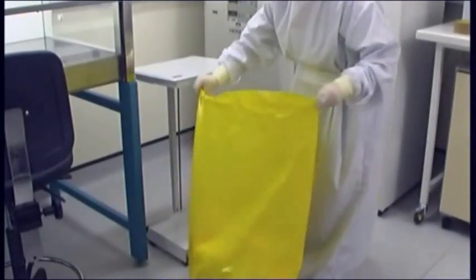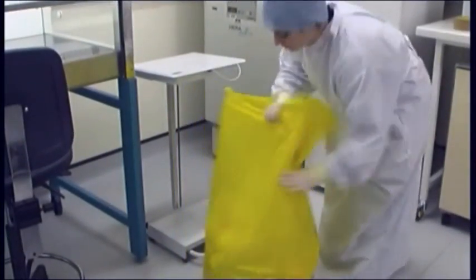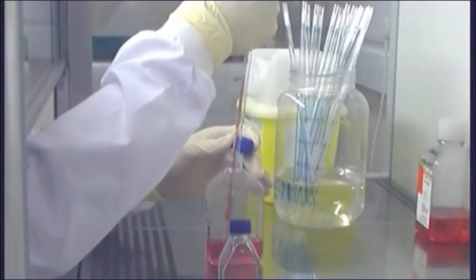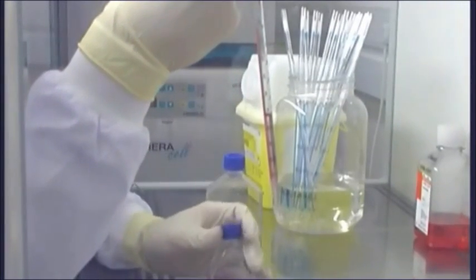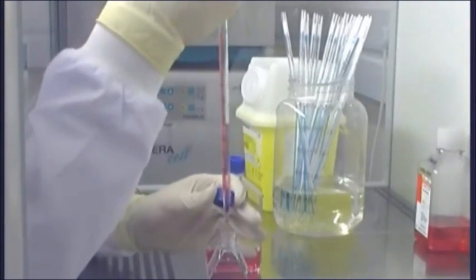Dispose of waste regularly and do not allow large amounts to build up. Keep a suitable container of strong disinfectant in or by the cabinet for used pipettes. Regularly empty and replenish this container.